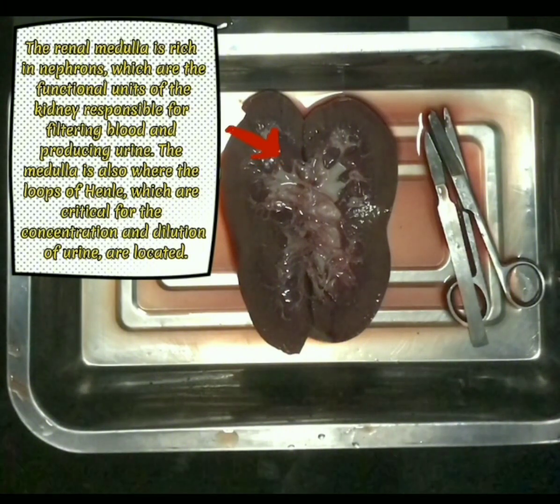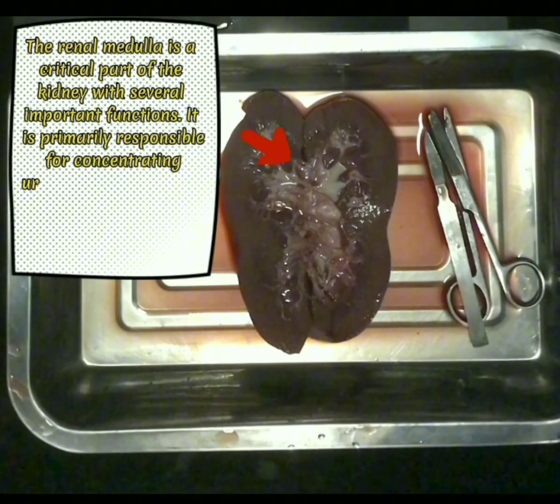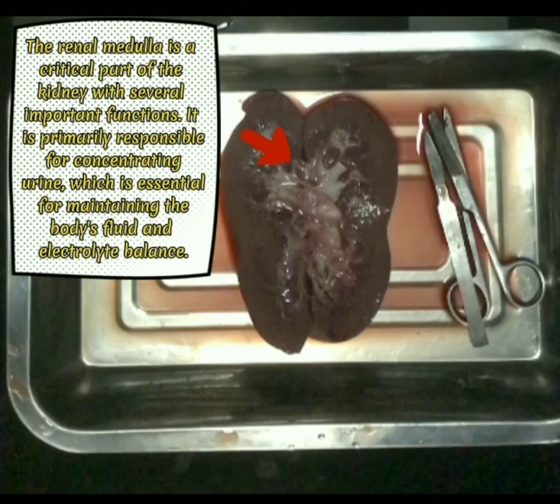In addition, we have 1 million nephrons in each kidney. The medulla is also where the loops of Henle, which are critical for the concentration and dilution of urine, are located. The renal medulla is a critical part of the kidney with several functions. It is primarily responsible for concentrating urine, which is essential for maintaining the body's fluid and electrolyte balance.